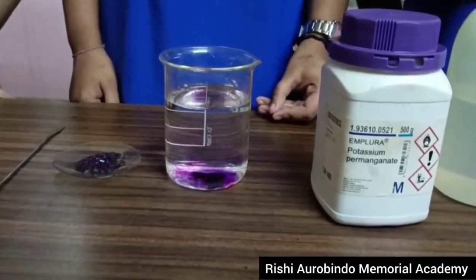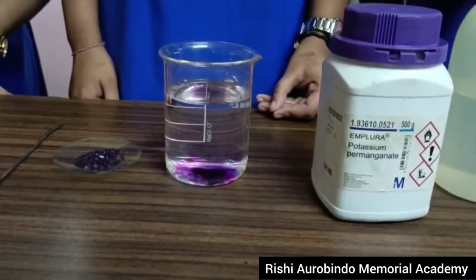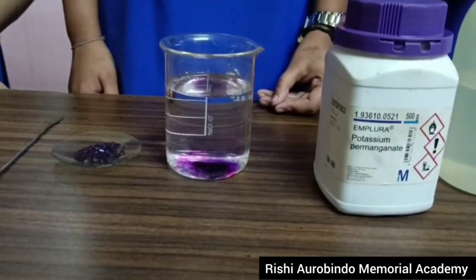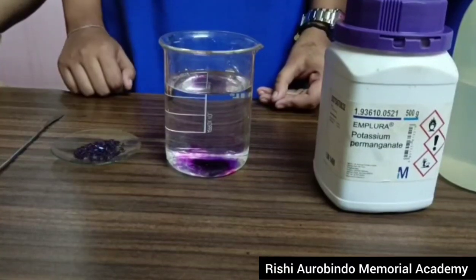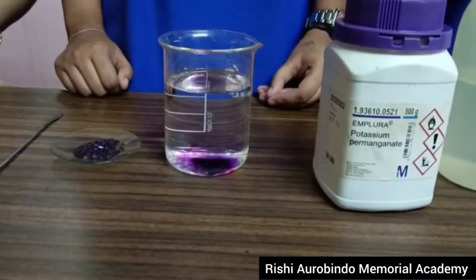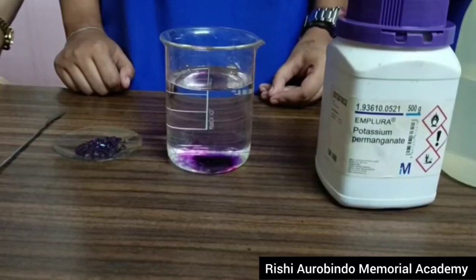Now, the molecules of potassium permanganate will move towards the upper layers gradually and the change of the solution will gradually occur. Let us wait for a few minutes.